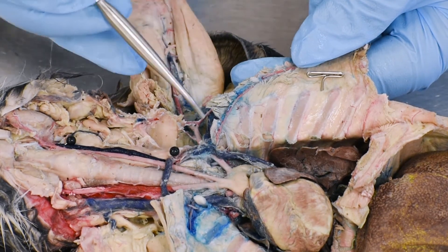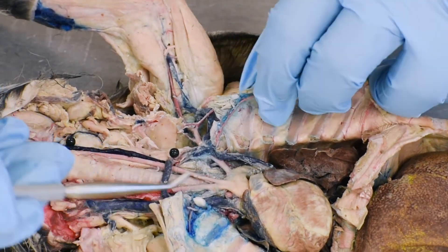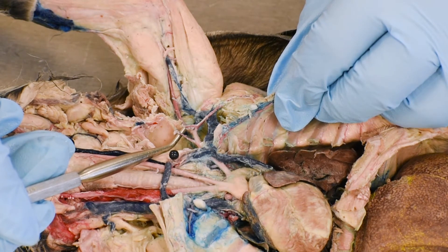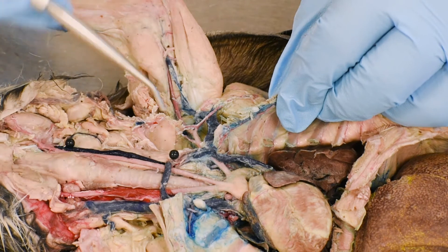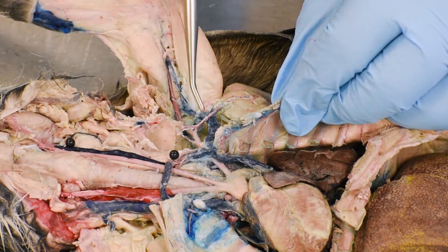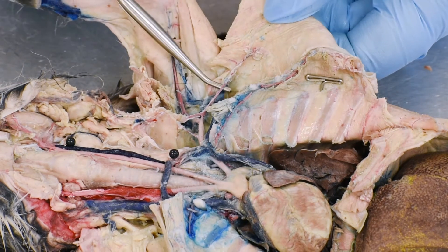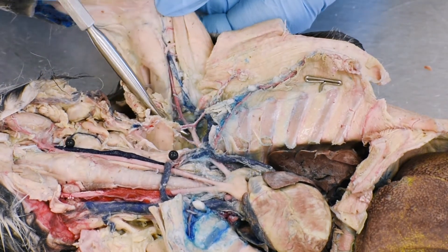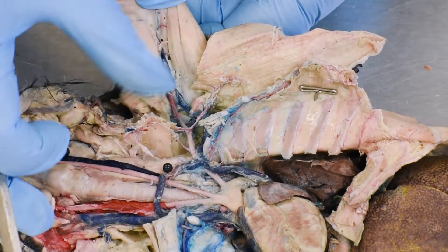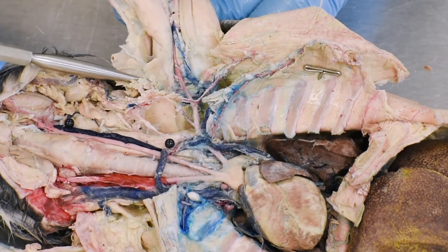In this region, running parallel with the artery is the internal thoracic or mammary vein. Coming back to the left subclavian, coming out through this area under the arm, the very first branch is the thoracic. The next branch is the thoracoacromial. Across from the thoracoacromial is called the lateral thoracic — you can see the pectoralis muscle distributed there. Then the subscapular is visible on the back if we stretch the arm. All of these are arteries.